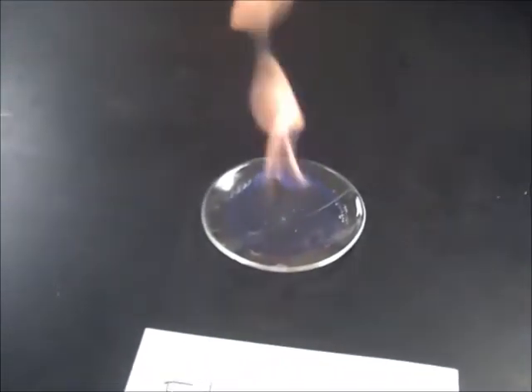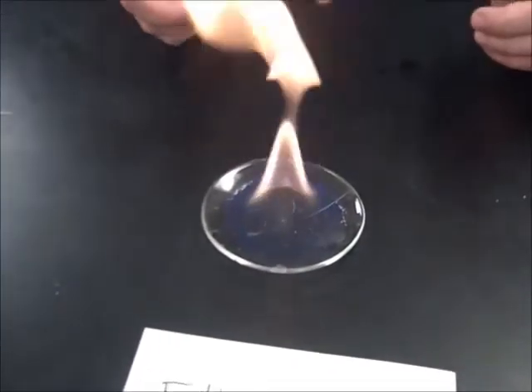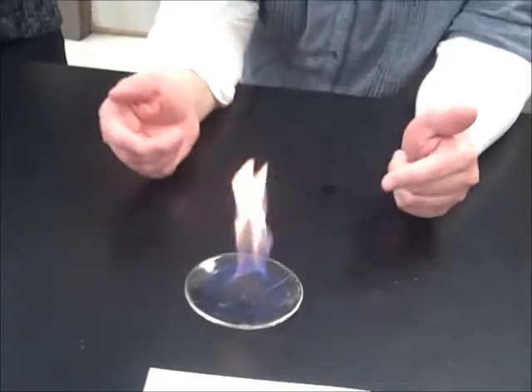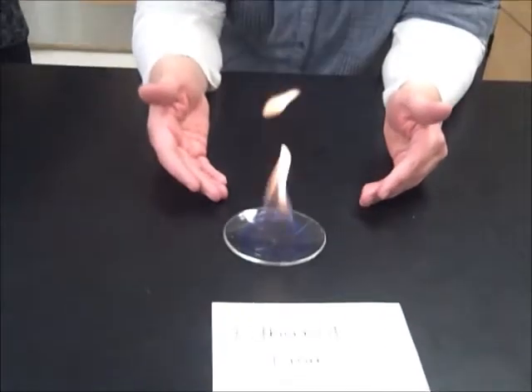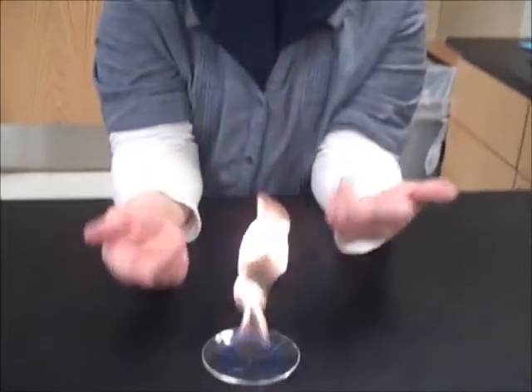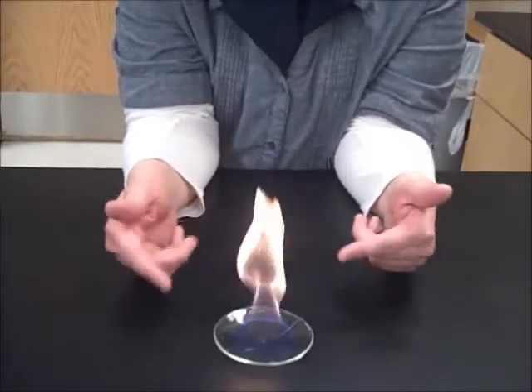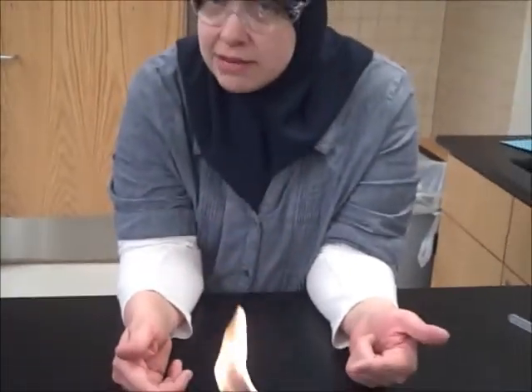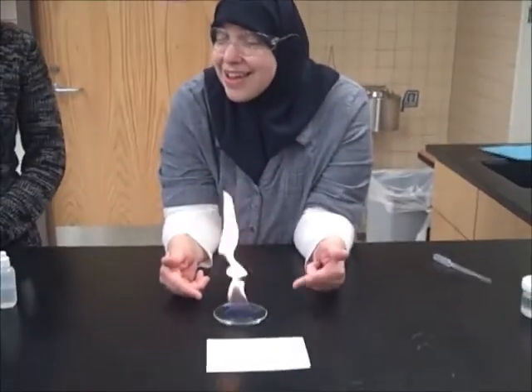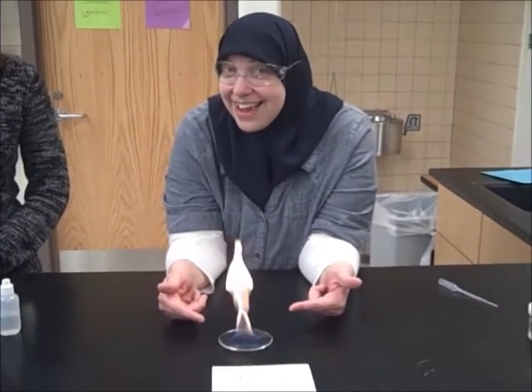Right now the ethanol is combusting and it will keep on burning until all the ethanol is gone. But it's not just burning the ethanol. It's also including oxygen, which is in the air, and that's what fire needs to burn. When this is all done, it's making, believe it or not, carbon dioxide and water. Combustion. Good stuff.